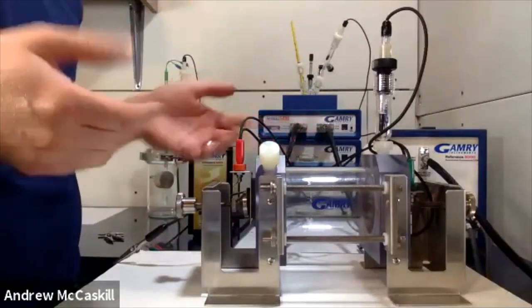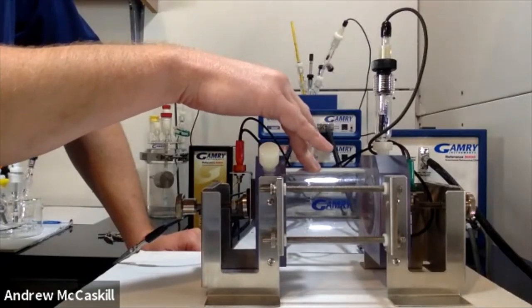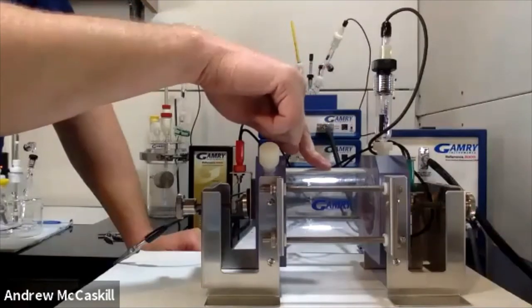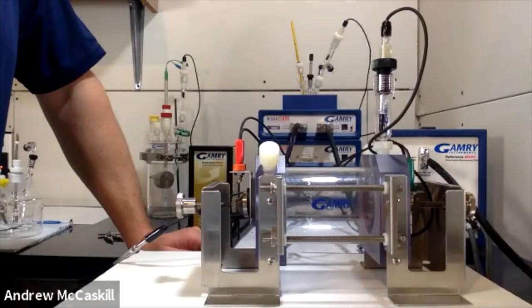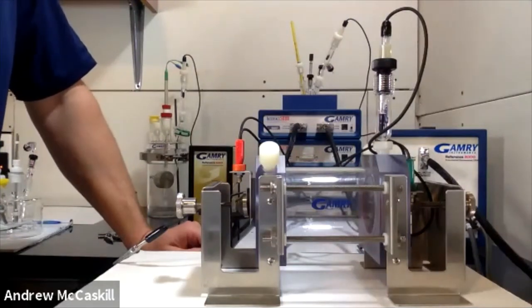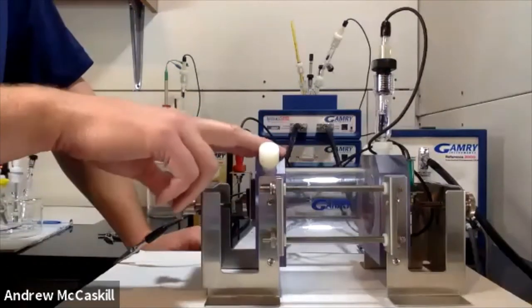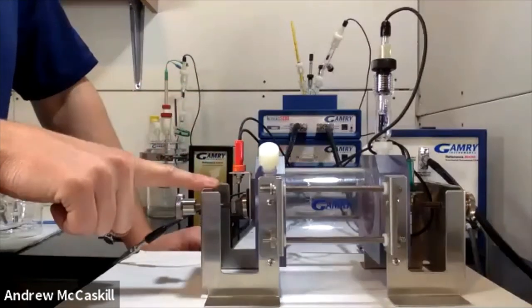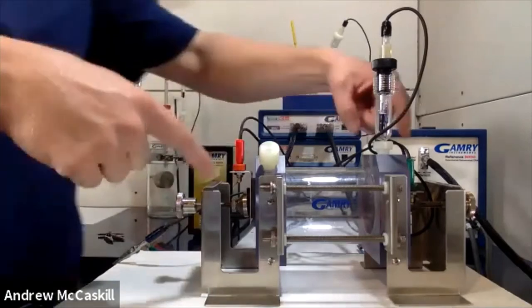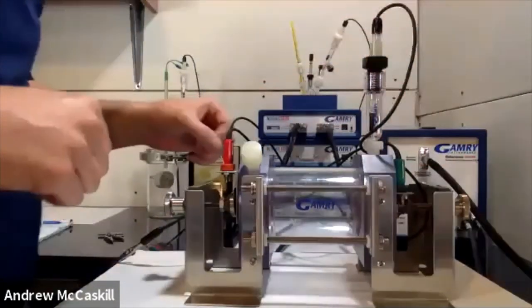There I have my three electrodes set up. The Paracell holds a larger volume than the last cell — about 200 to 400 milliliters. The cell body is made of polycarbonate, so if you're doing high-alkaline media you might want to go with a cell like this to avoid damaging glass. It has PTFE-encapsulated o-rings on either side, which are chemically resistant for high-alkaline media. The kinds of experiments you can look at include electrochemical noise, corrosion of materials, and longer experiments. You can also look at galvanic corrosion — looking at a galvanic couple — which goes back to the surface area question: if you have the same surface area on both sides with the same material, you can do that galvanic corrosion experiment.